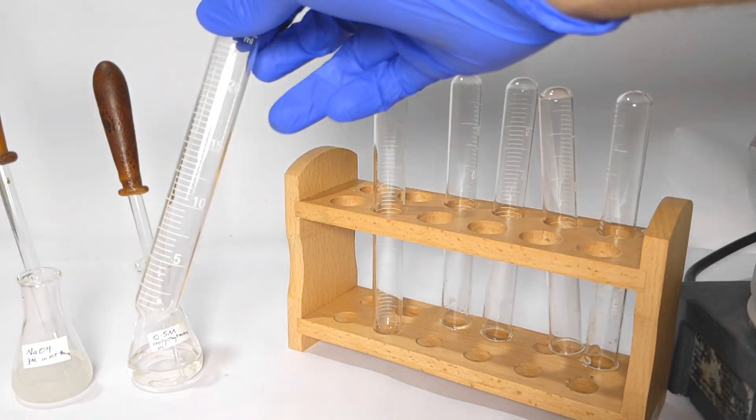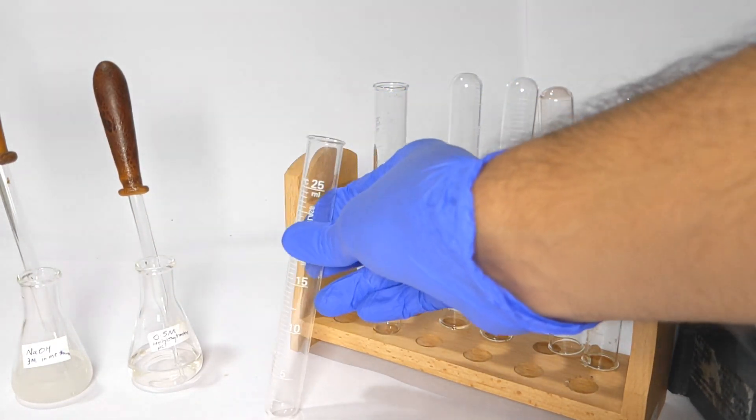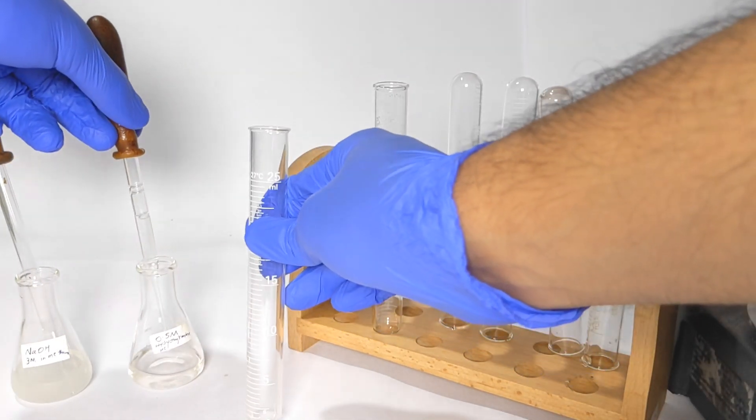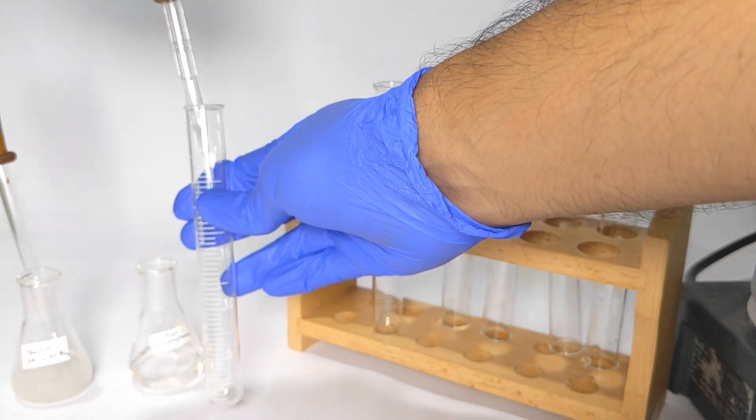For that we first take a dry test tube. Into the test tube we add about 2 milliliters of 0.5 molar hydroxylamine hydrochloride solution in methanol.